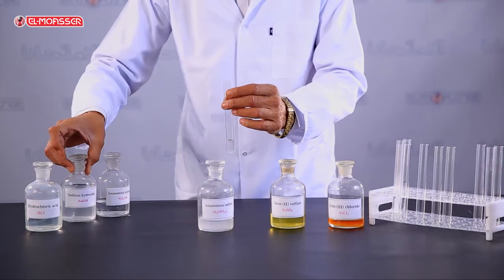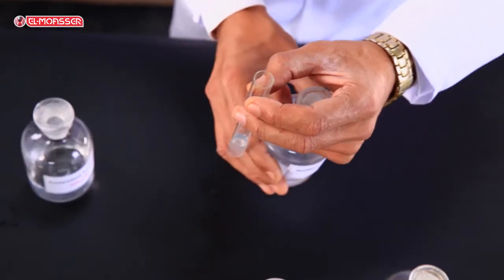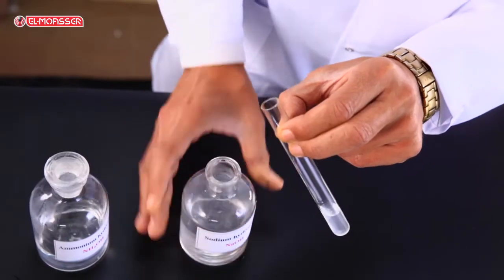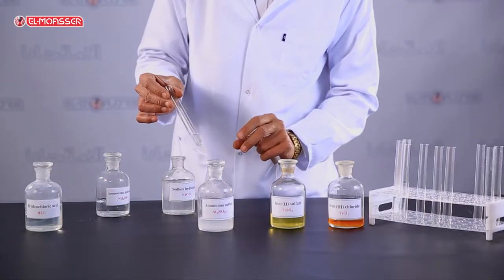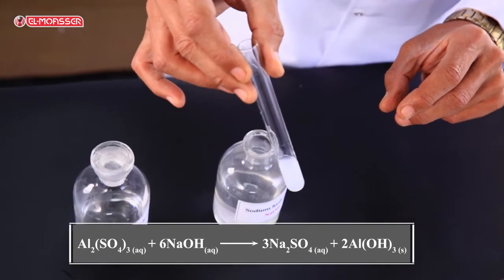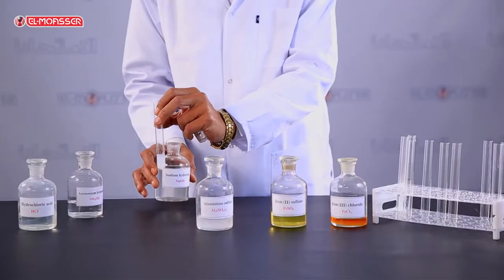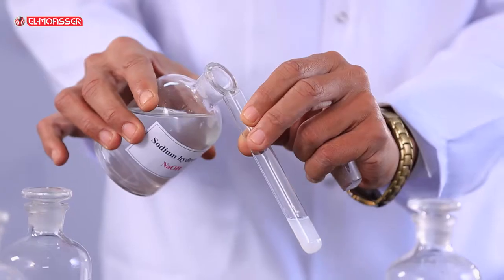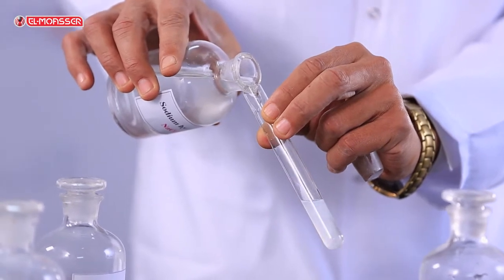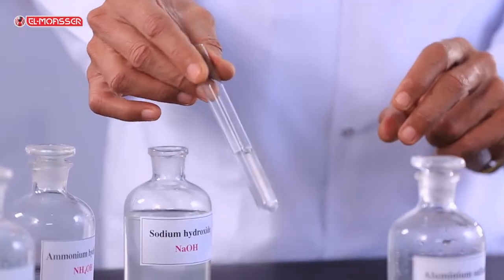In the confirmatory experiment, add two drops of sodium hydroxide solution to aluminum sulfate solution. A white gelatinous precipitate of aluminum hydroxide is formed. Then add excess sodium hydroxide solution to the white precipitate.